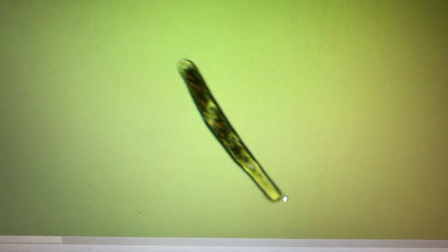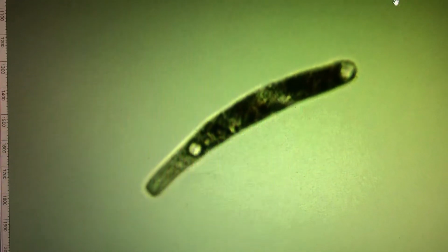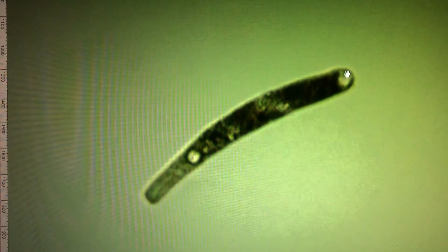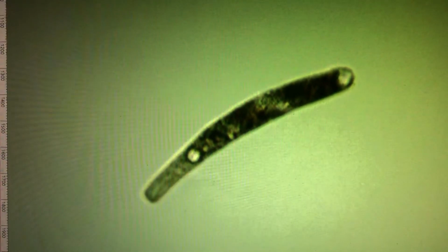So once again, you see the neck, you see the body, you see the bottom area where it excretes. You see the zooxanthella, it's only got about maybe 10 left inside. So it's running low on energy reserves. Here's another picture. Again, the mouth is pretty big. It's pretty much the whole front. And then the tail area and the body is covered in cilia. That's how it moves so fast.